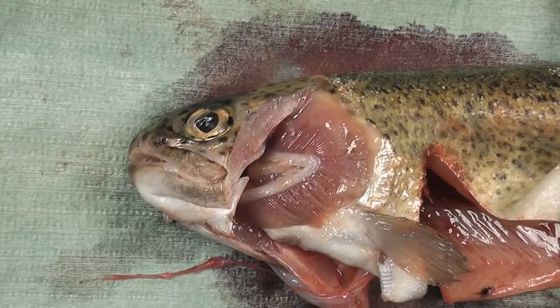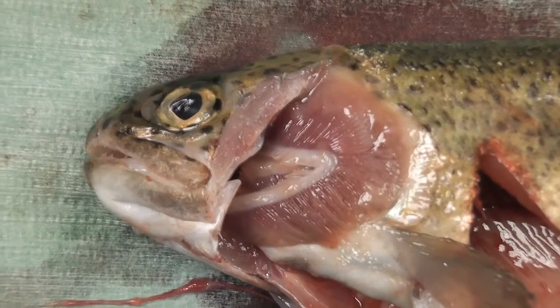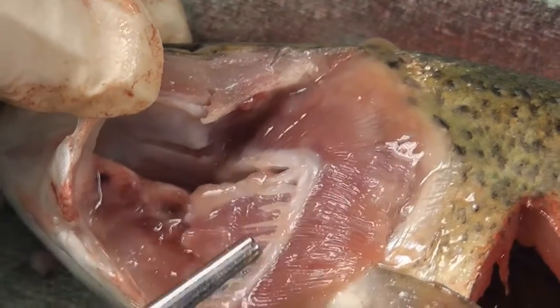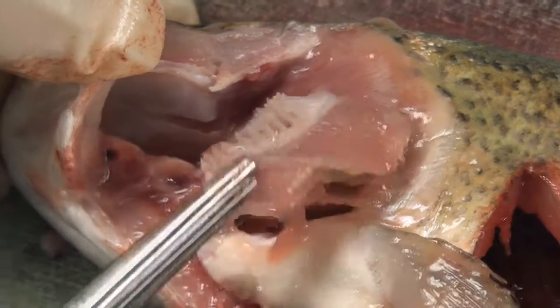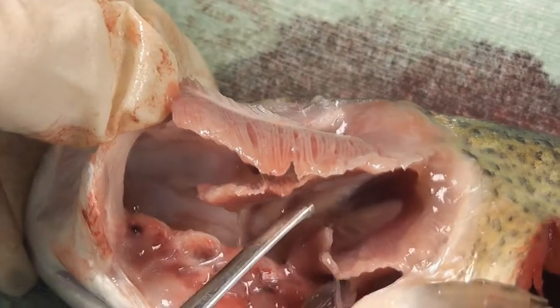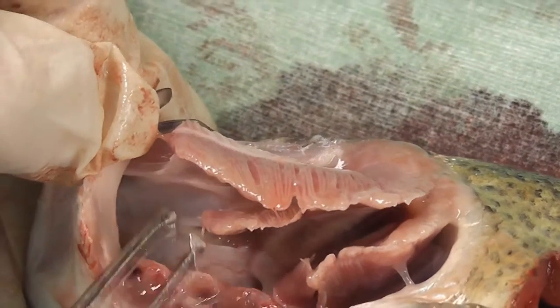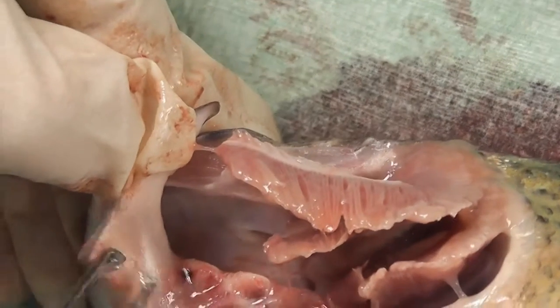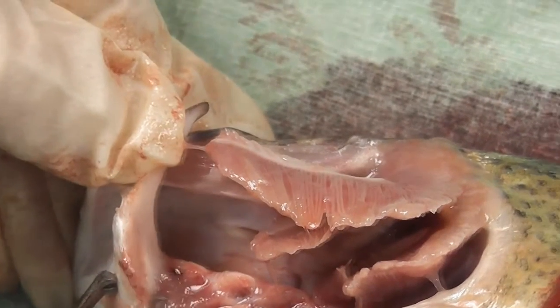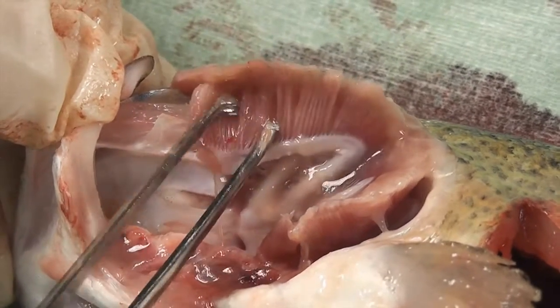Now we can see the gills. Each gill supports two rows of filaments, and the filaments of one row constitute the hemibranch. The two hemibranches of the gill arch form the holobranch. The trout has four pairs of holobranchs. The role of the gills is to optimize the exchange of dissolved gases between the water and the blood of the fish.